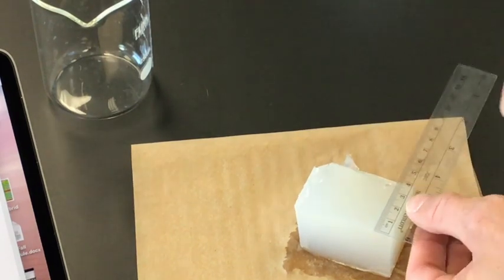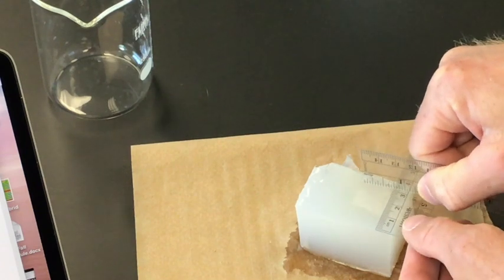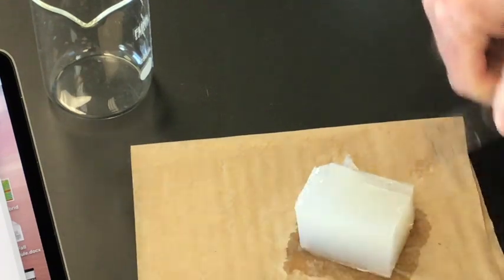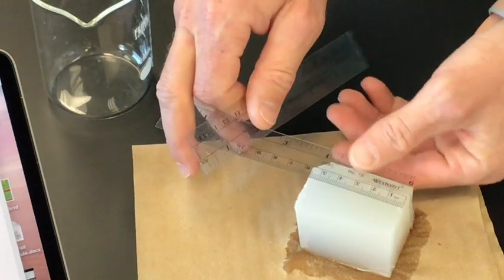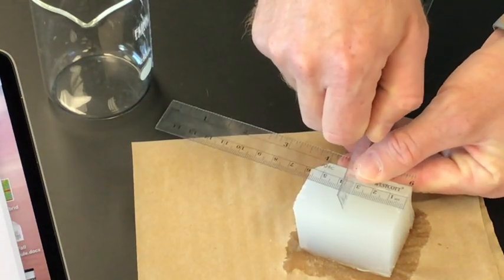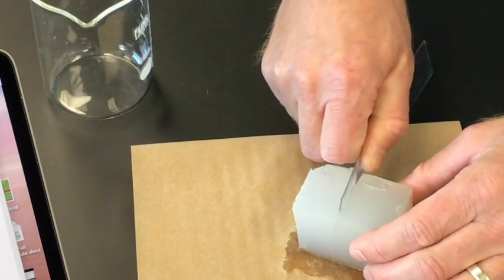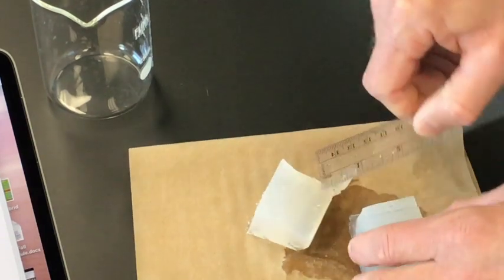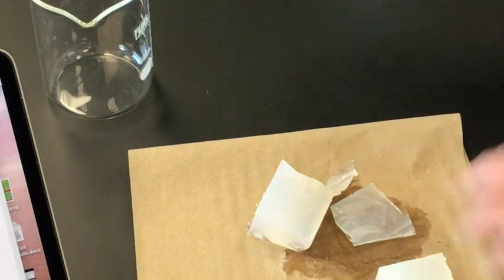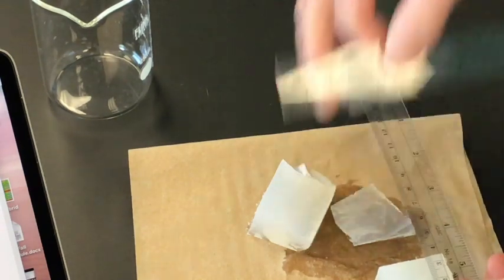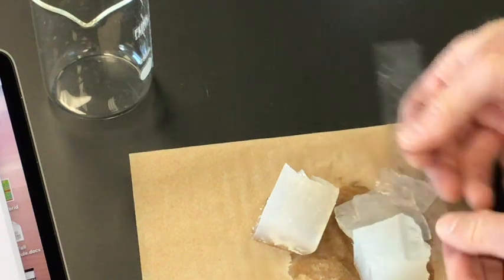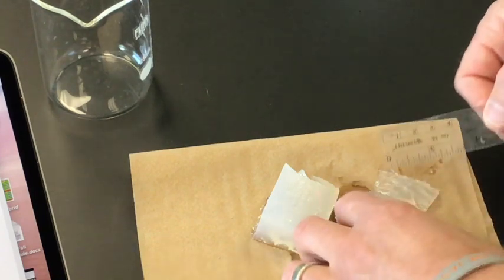So I'm going to make my largest cube first, so I'm going to measure a three side, and three this way, because a cube is all sides being equal. And then this way... and then I can double check my measurements, three by three, that's still a little big.